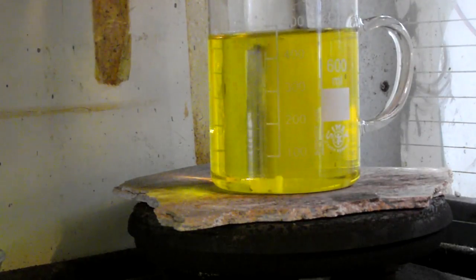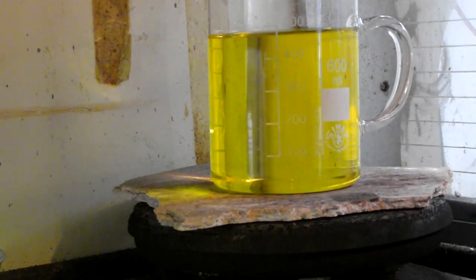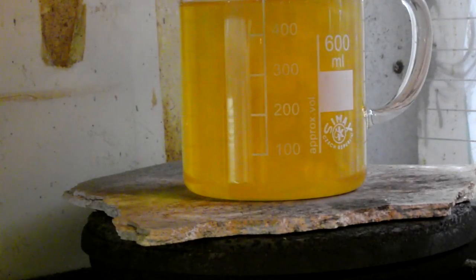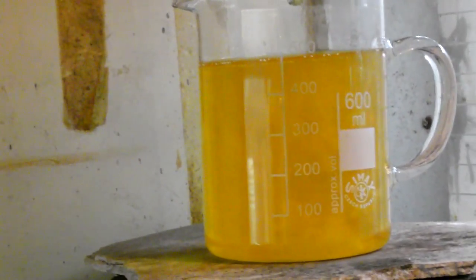Again, no visible reaction. I left the solution to boil, and as soon as it started boiling, yellow shining matter appeared.